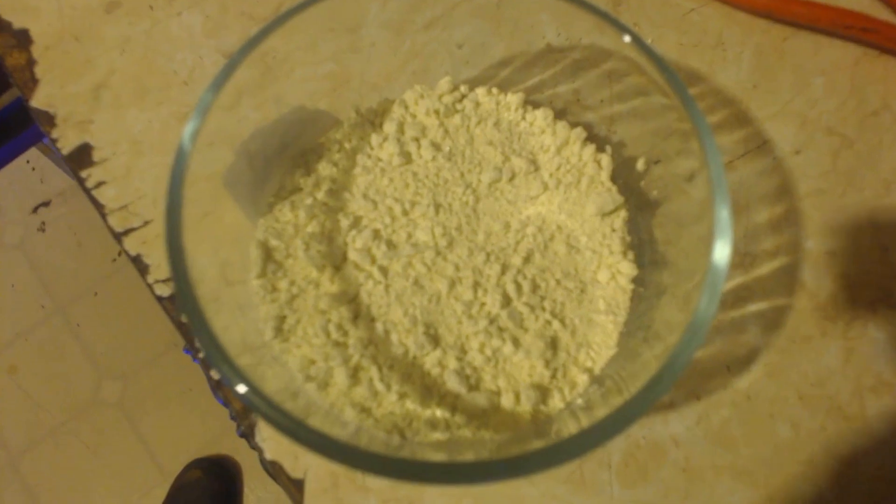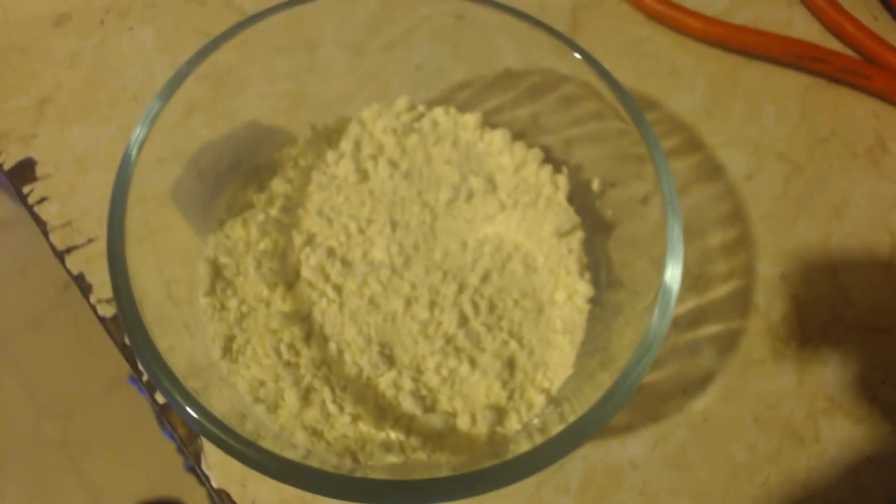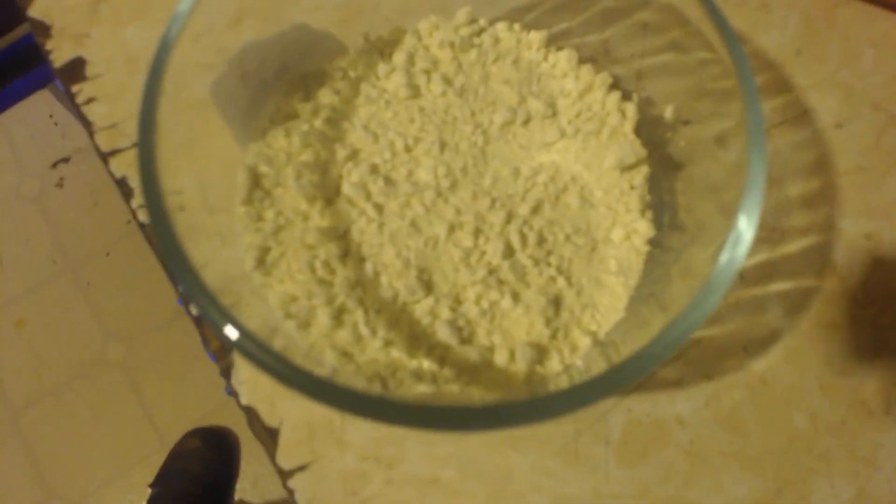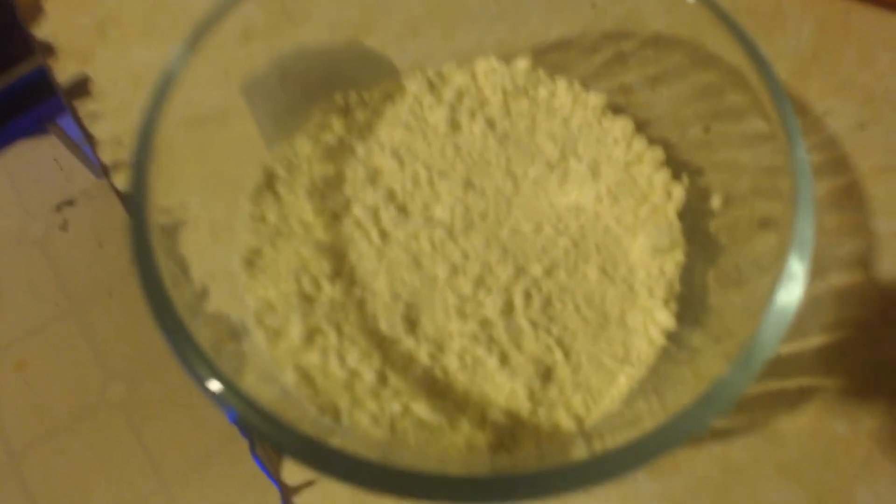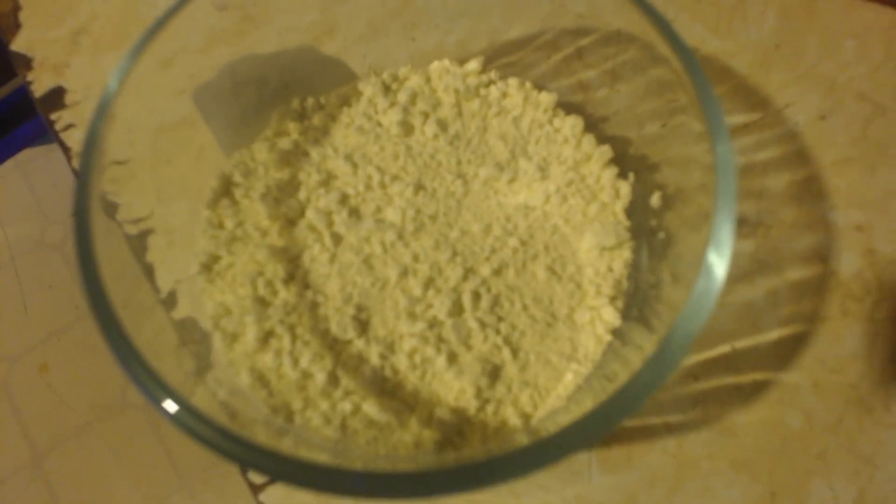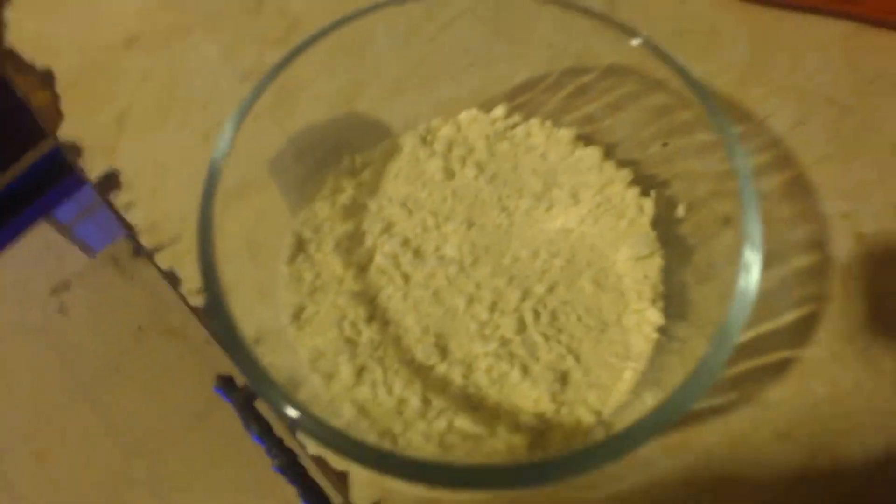Well, there it is. It's yellow. It's a nice color though. It's a very clean yellow. It definitely weighs too much. It's like 30 grams heavier than it should be. So, I'm going to put it in a desiccator.